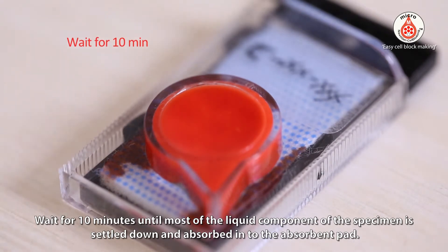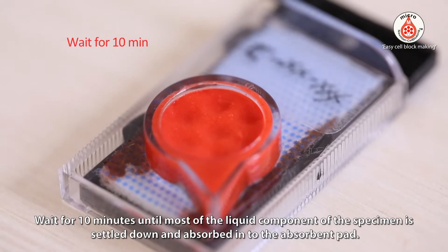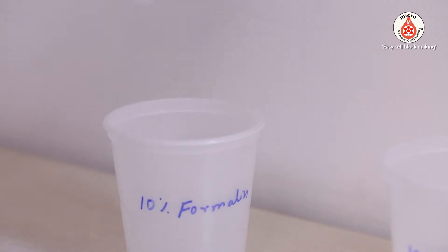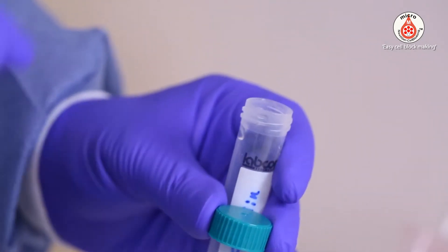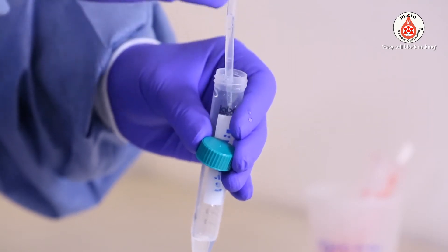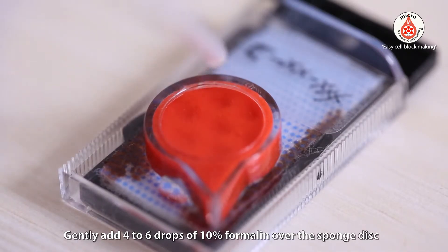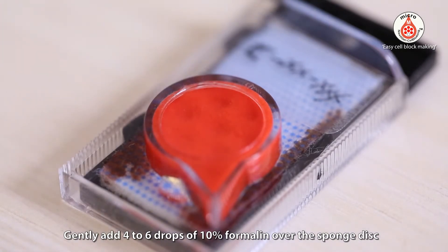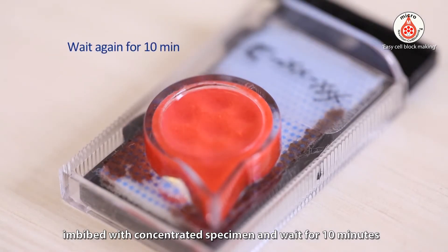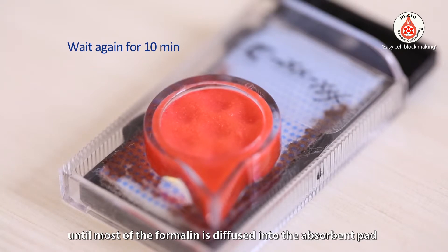Wait for 10 minutes until most of the liquid component of the specimen has settled down and been absorbed into the absorbent pad. Then gently add 4 to 6 drops of 10% formalin over the sponge disc imbibed with concentrated specimen, and wait for 10 minutes until most of the formalin has diffused into the absorbent pad.